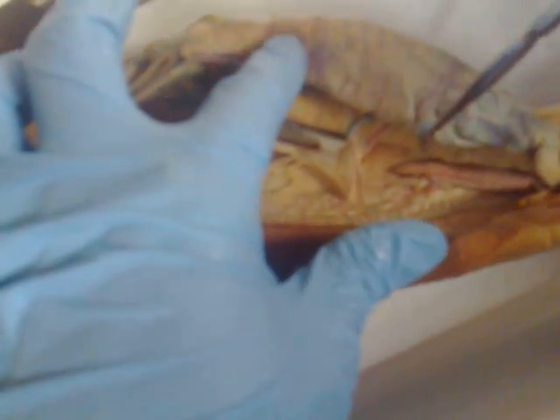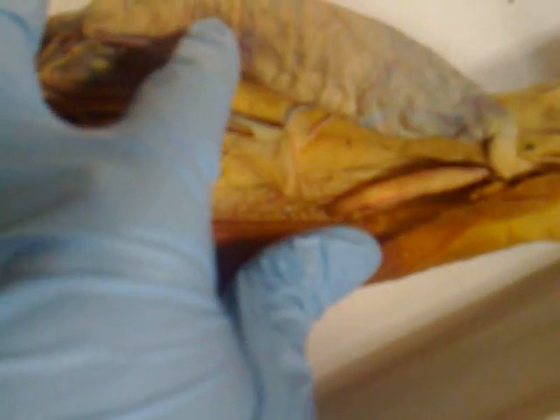Then we have the digitiform gland, which is right here. Digitiform gland. And then we have the spleen. This is the spleen.